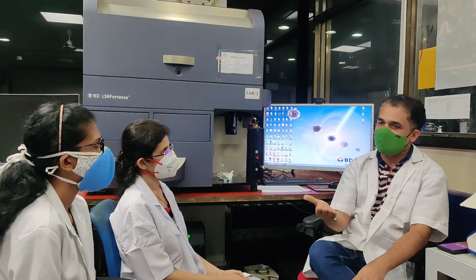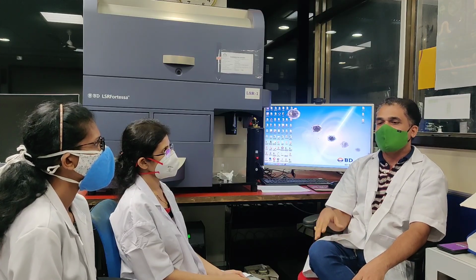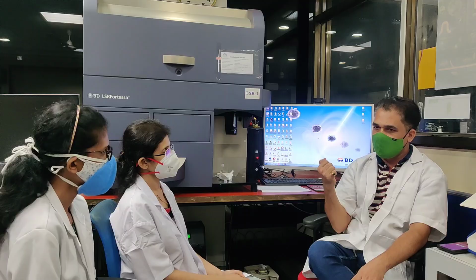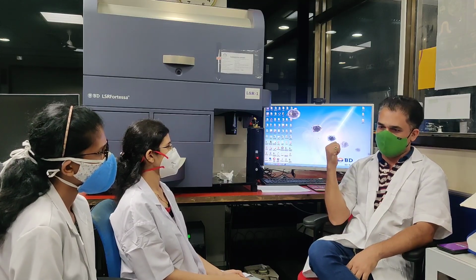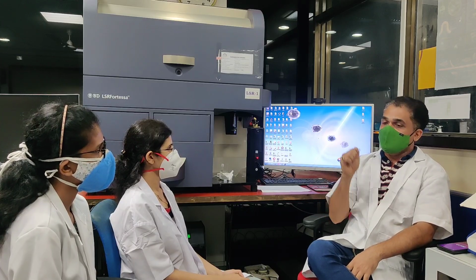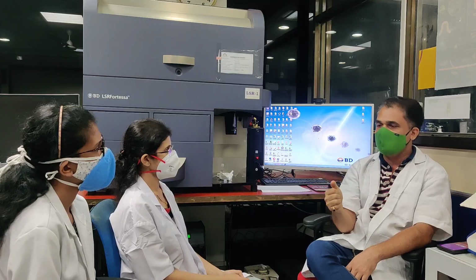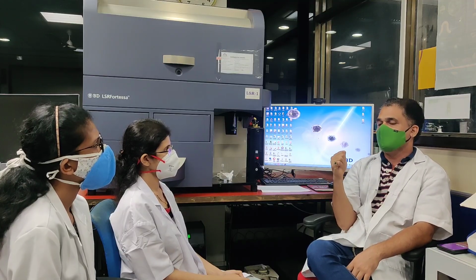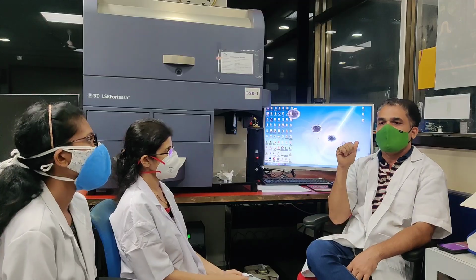In a similar fashion, we are going to do the Stemtrol control, where we add 100 microliter of normal blood cells with reverse pipetting. Then we add 20 microliter of Stemtrol control to the tube. We do not add 7AAD at all for samples like controls, which are preserved samples, even for the UK NEQAS as well as the CAP sample.